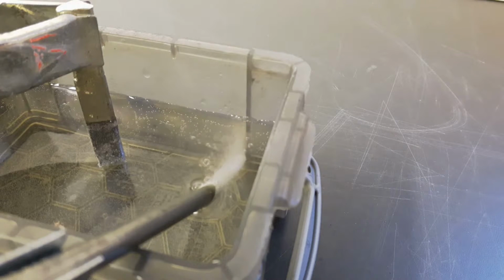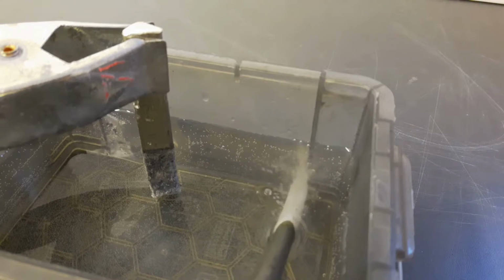Okay, 5 minutes later and I am frustrated, because it is actually electrorefining tin. Yes, exactly what I thought did occur. No fortune this time. The table seemed to be correct. 1/100 of a volt. That does prevent me from creating stannous chloride solution. But no matter. I always wanted to purify this tin.